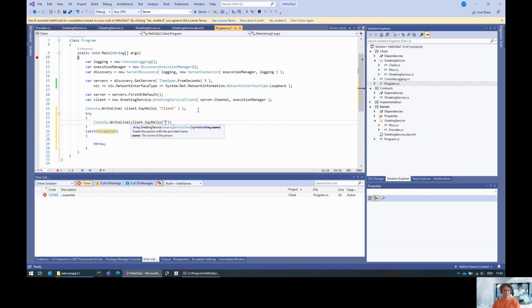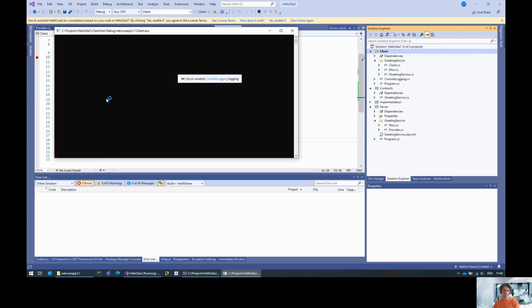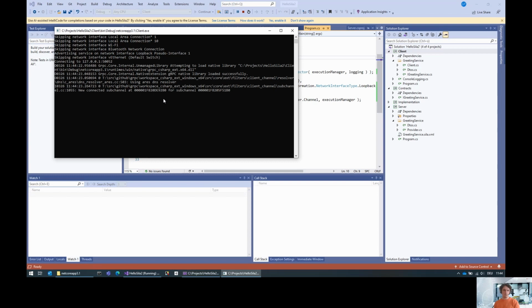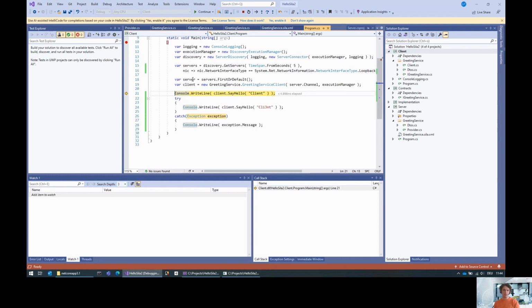But actually, we can also do something like this. Then we catch the exception, and in that case, we do a console write line of the exception message. And then we debug the client. There's still this 5-second timeout for the discovery that we specified there. But it found the server, you see that here.